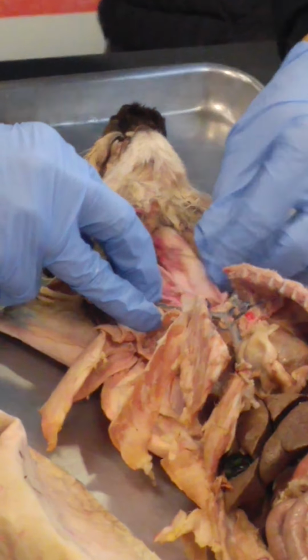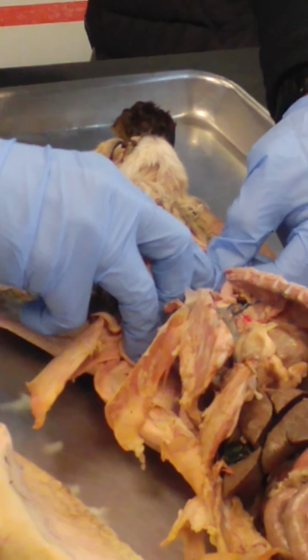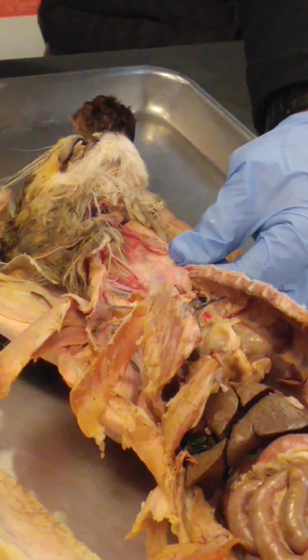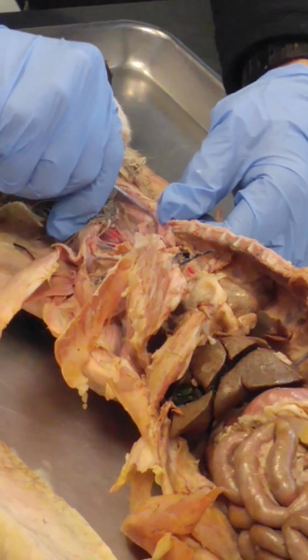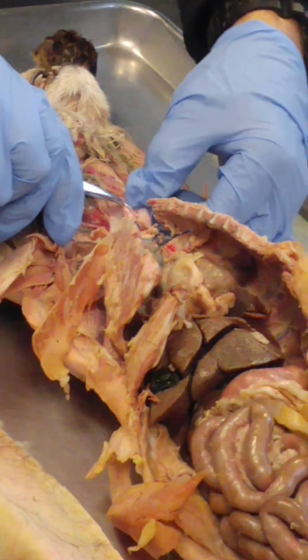Esophagus, of course, the esophagus is going to sit underneath the trachea. You can see it right here. I kind of separate the tissue. This is esophagus here, and that's trachea right there. So you haven't separated yet, but it's really easy to do. So there you go. There it is.